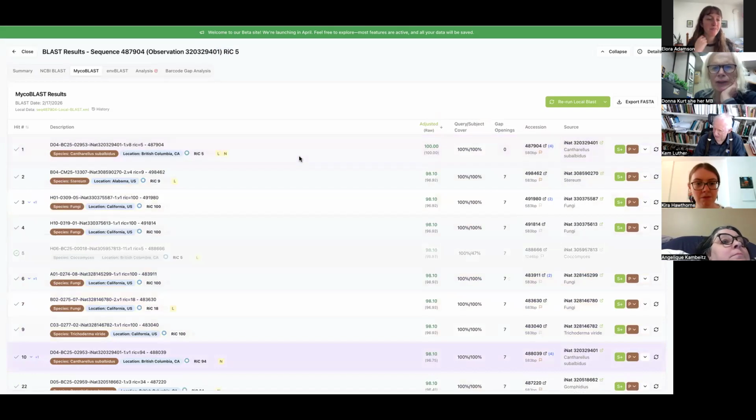Yeah. So when you say this one, you meant that although there's a lot of sequences in there, this blast has the same problem.